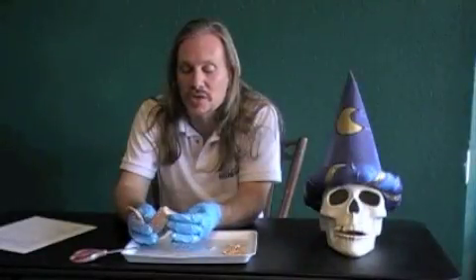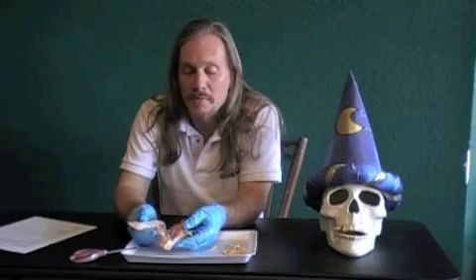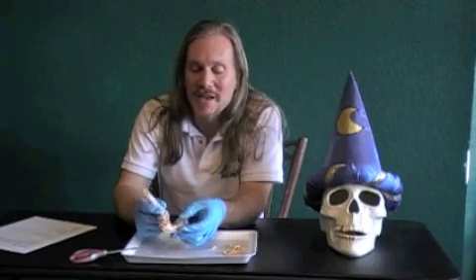Take a look at the muscles and see how the muscles work. Play with this one for a while, but remember this is not going to be eaten afterwards - you can't fry this up and eat it. This one's got to be trash. But you're welcome to do whatever you want with the rest of the package. So play with this, have fun with it, then do your discussion.